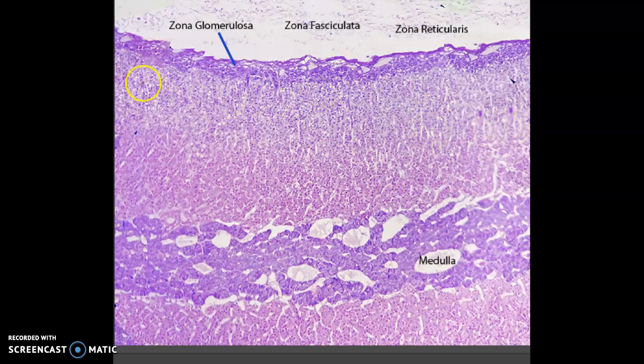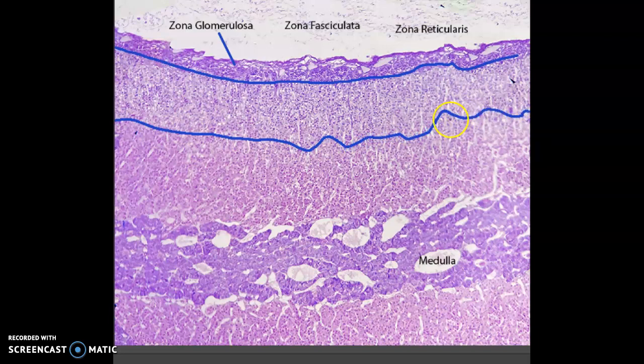Next is the zona fasciculata. It's right in here. And I can see the top border right here with the glomerulosa. That's a nice clear border. Now with the reticularis down here, it's harder. It sort of looks like it goes like this, and it's not nice and crisp, but that's what it looks like it's doing there. And then the zona reticularis is down here in pink.